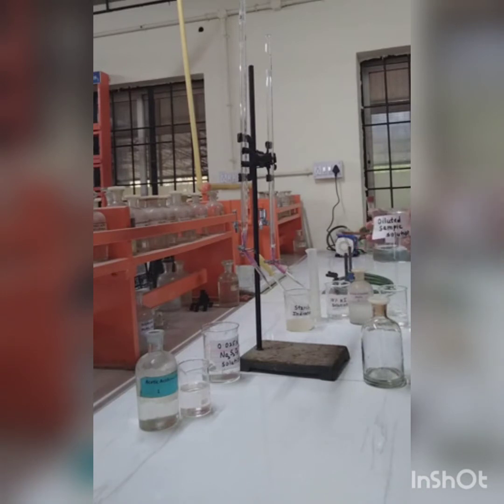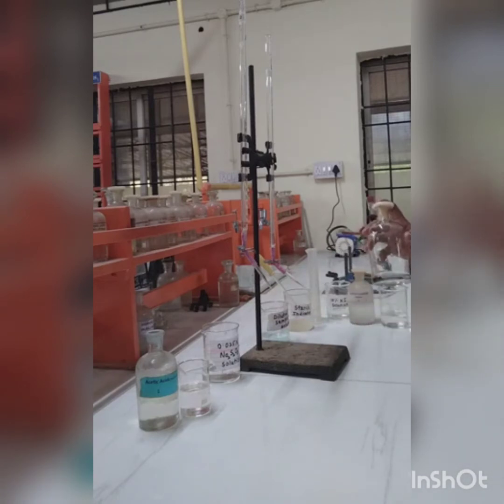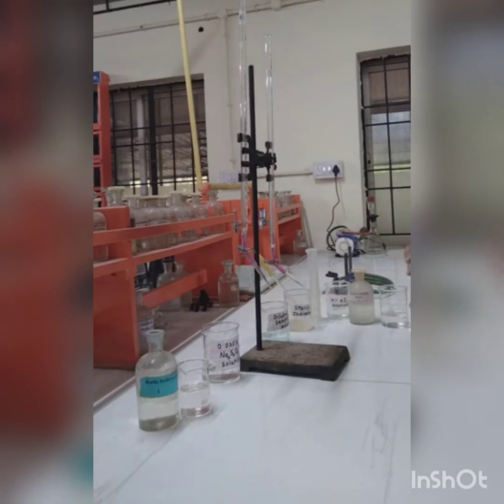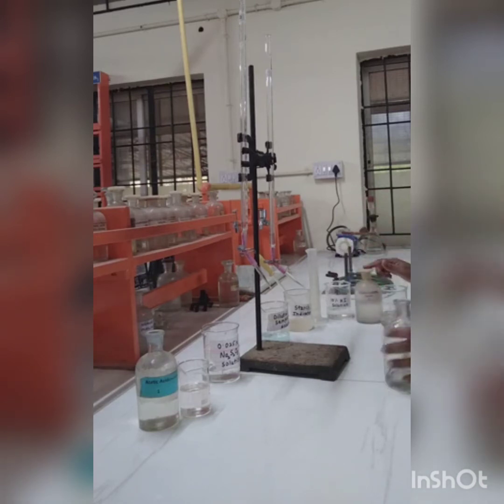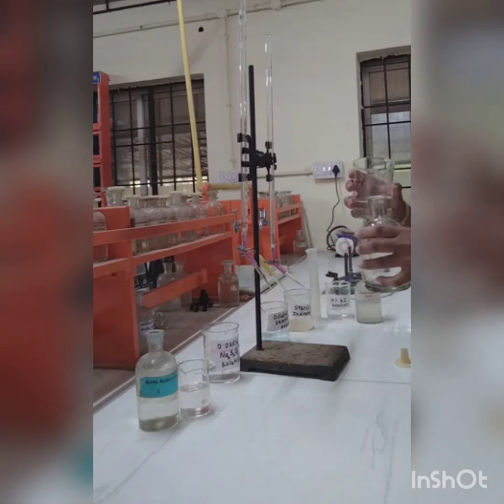I have filled this diluted sample solution in this burette, and from this burette I have taken 10 ml diluted sample solution in a stoppered bottle. Now I am going to titrate this solution with 0.025 normal sodium thiosulfate. Before titrating, first we are going to add 2 normal sodium hydroxide to this sample solution till just turbidity appears. Now I have taken this sodium hydroxide solution in this beaker. Now I am going to add this sodium hydroxide solution to the stoppered bottle so that just turbidity appears.